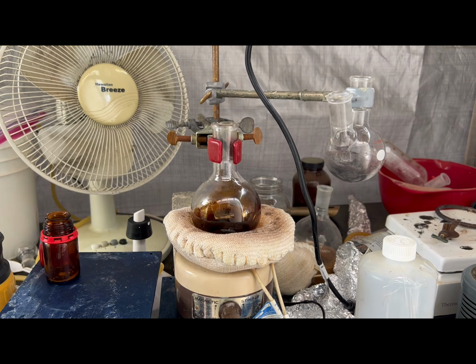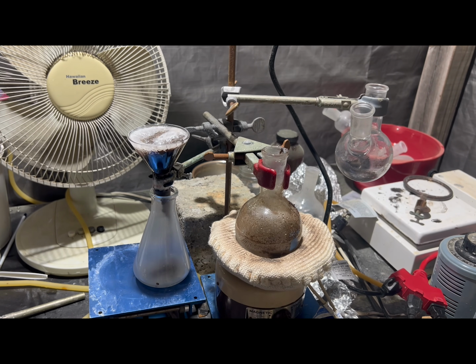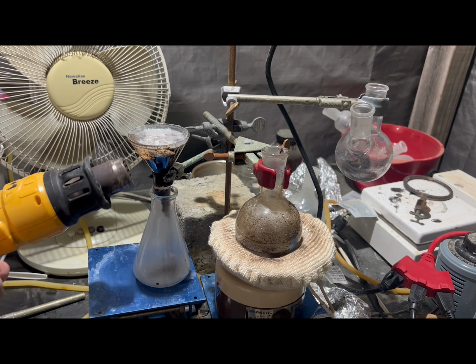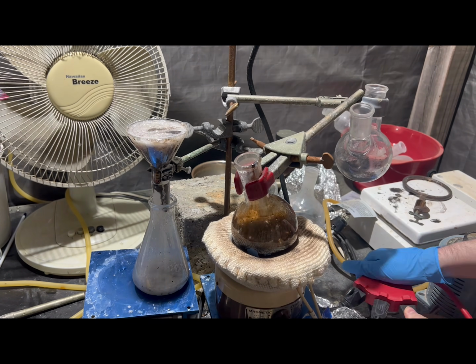To recover benzoic acid, I boiled the tarry junk in water to hydrolyze any benzoyl chloride and benzoic anhydride. Benzoic anhydride is a side product that can form during the reaction with a super high boiling point, well, relatively, of 360 degrees, so it couldn't have boiled over with any of the benzoyl chloride.